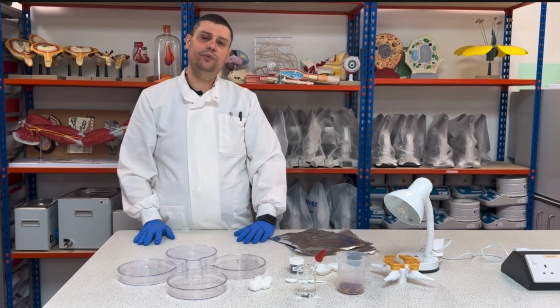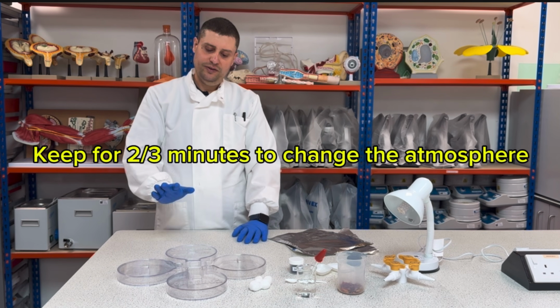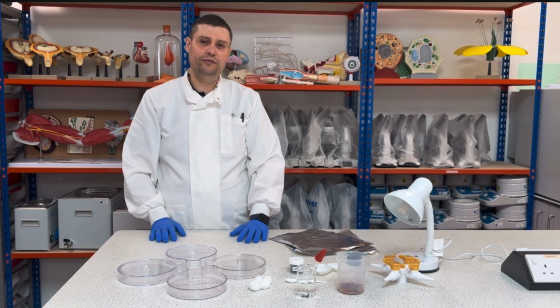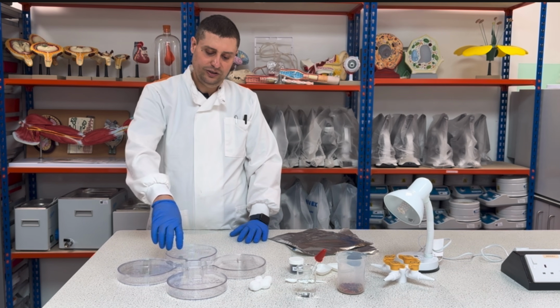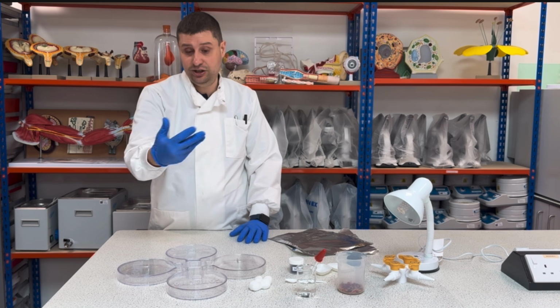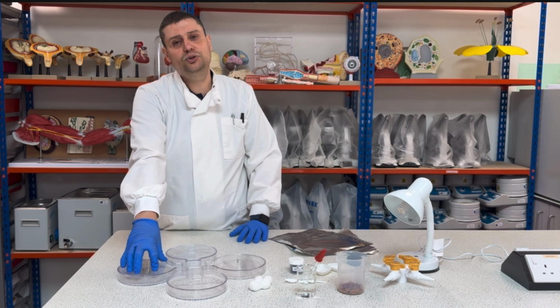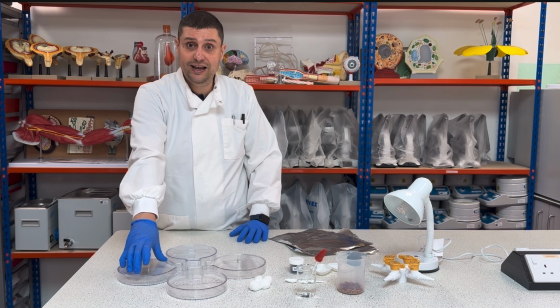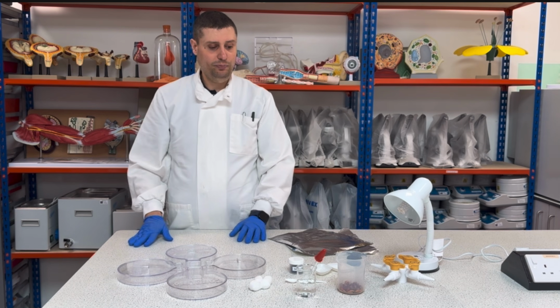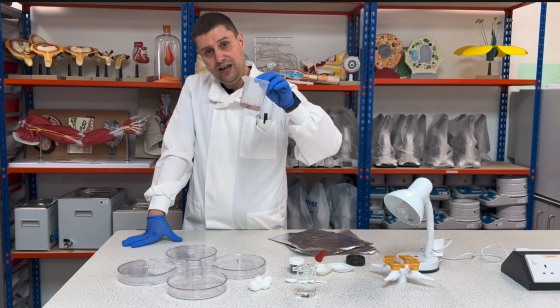After that, I will keep my chamber for about 2-3 minutes to allow enough time for the water vapor to condense and accumulate inside the chamber, and on the other hand, for the silica to start to absorb all the damp in the air and make the place dry. After that time, I will place my animal.